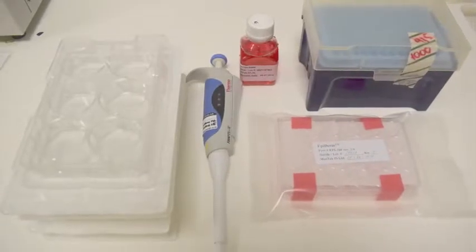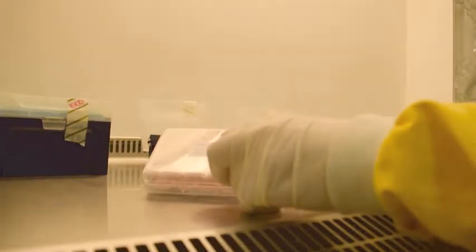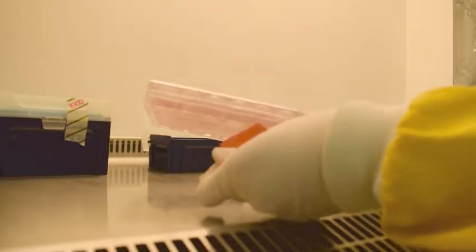Tissues are carefully unpacked in a laminar flow hood to reduce the risk of microbial contamination.